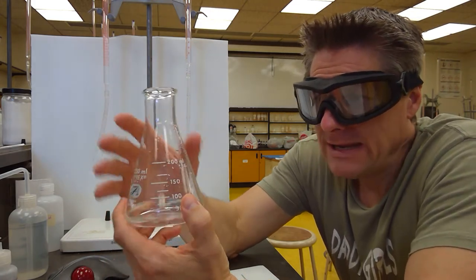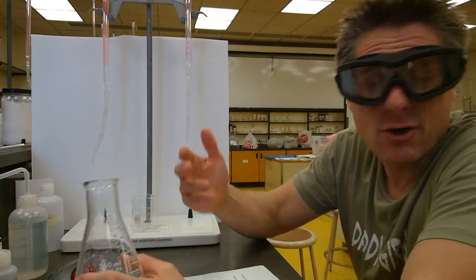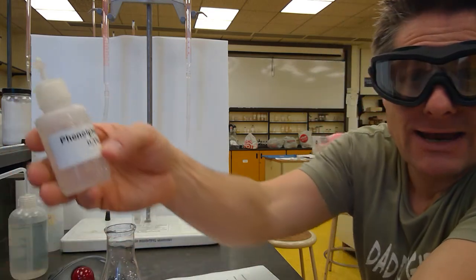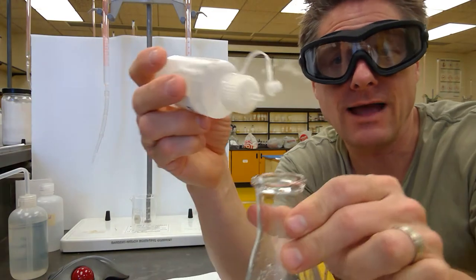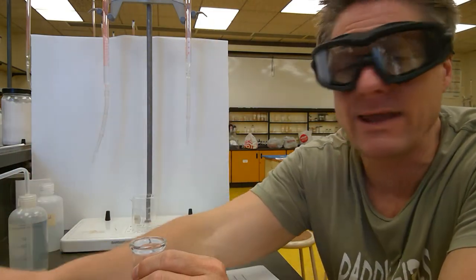Now, we know that the acid here is clear and colorless, and the base is clear and colorless. Everything's clear and colorless, so how do we ever know that the acid and the base neutralize each other? That's called the equivalence point. You have equivalent amounts of both. That's why we add an indicator, lots of different kinds of indicators. Typically you're going to want to add two or three drops. So let's put in two drops there. Three came out. I wouldn't go more than four because that's a weak acid itself.